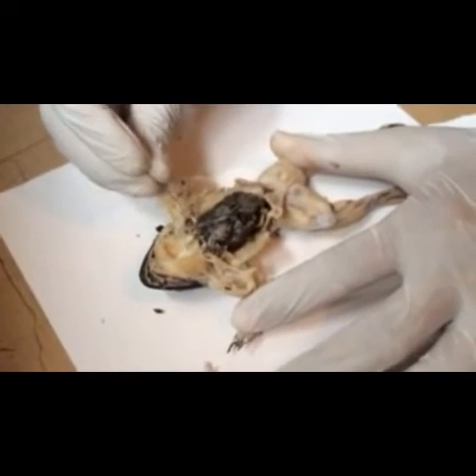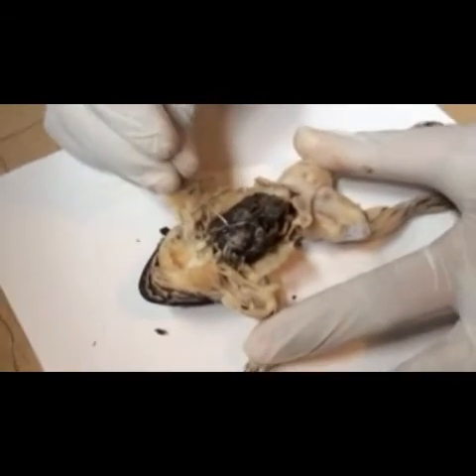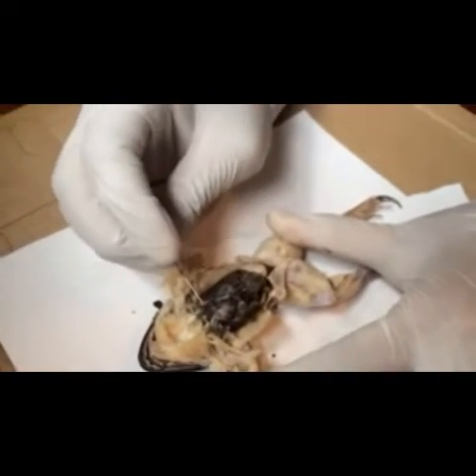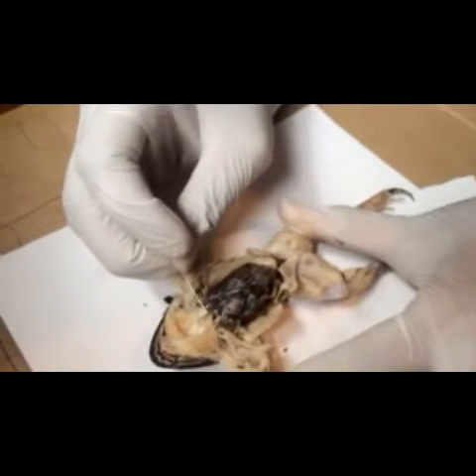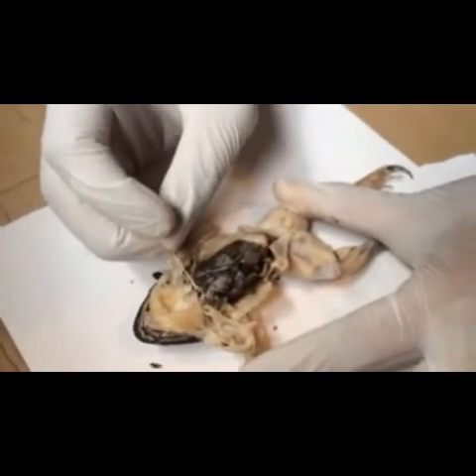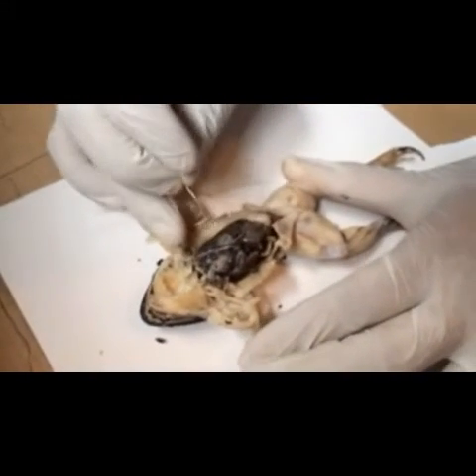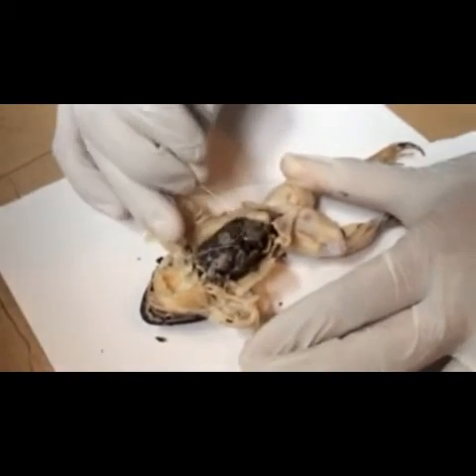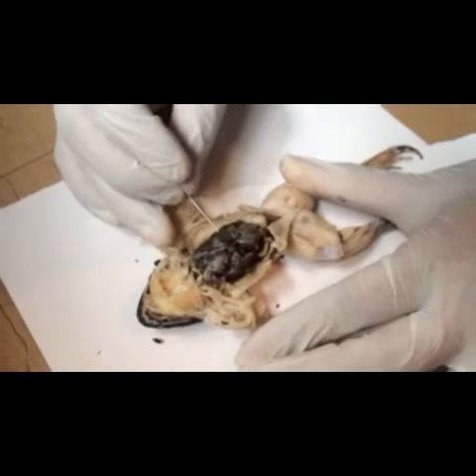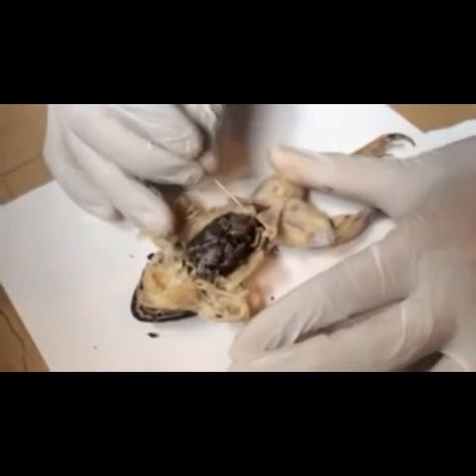I will discuss the digestive system of the frog. First, the esophagus — here is the esophagus. Now this is the liver. Below the liver you will see the cystic duct and the hepatic duct, but because the frog is small it is not very prominent.